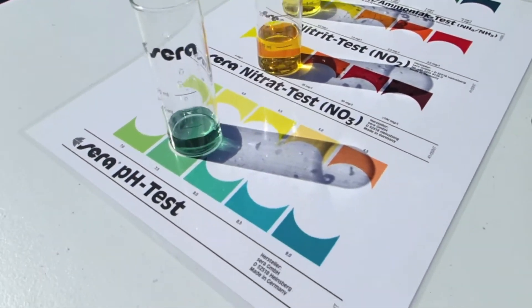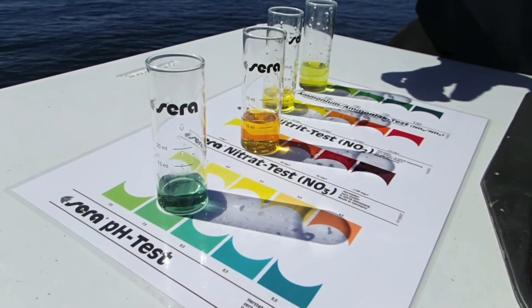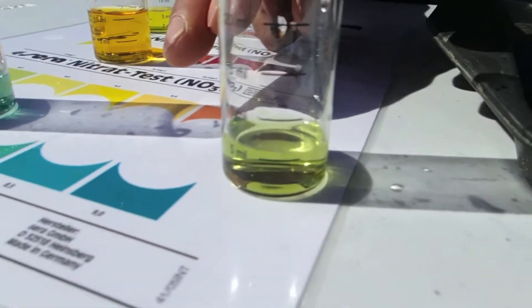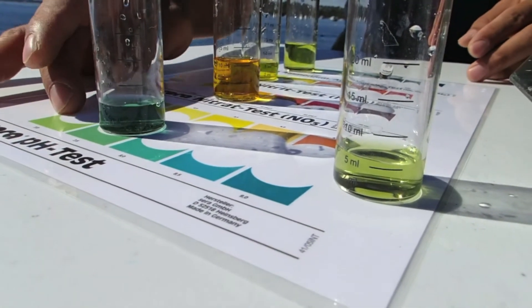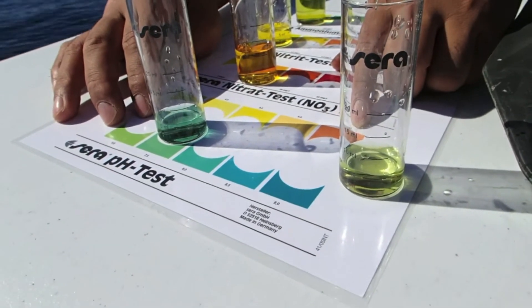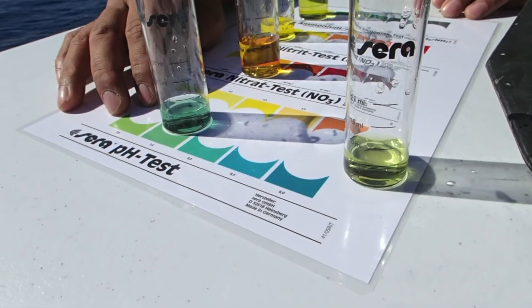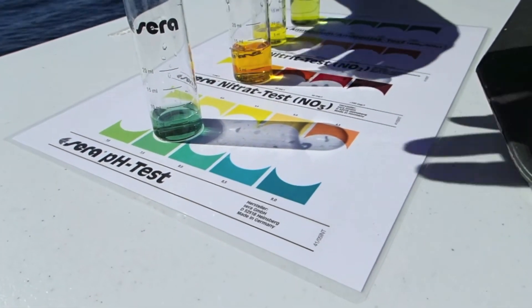What we tested before was carbonate hardness or alkalinity, which was four degrees. So that is very good as a test for the buffering capacity of the water. That would guarantee that your pH does not drop from a normal pH of seven down to dangerously low levels of four and a half or below. So the alkalinity is basically a measure of the buffering capacity of the water against pH fluctuations. Four degrees is quite acceptable — it's quite good.